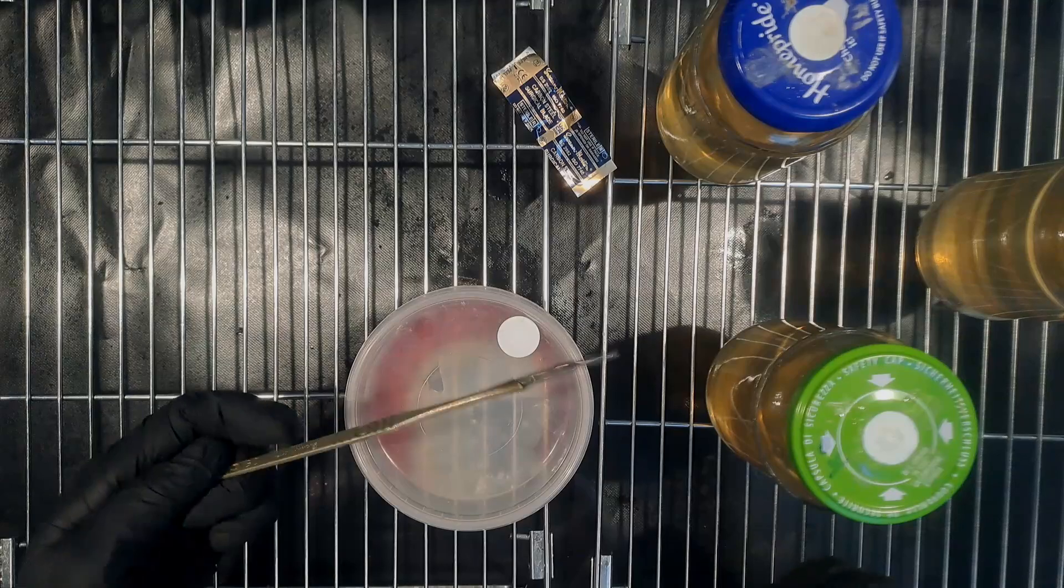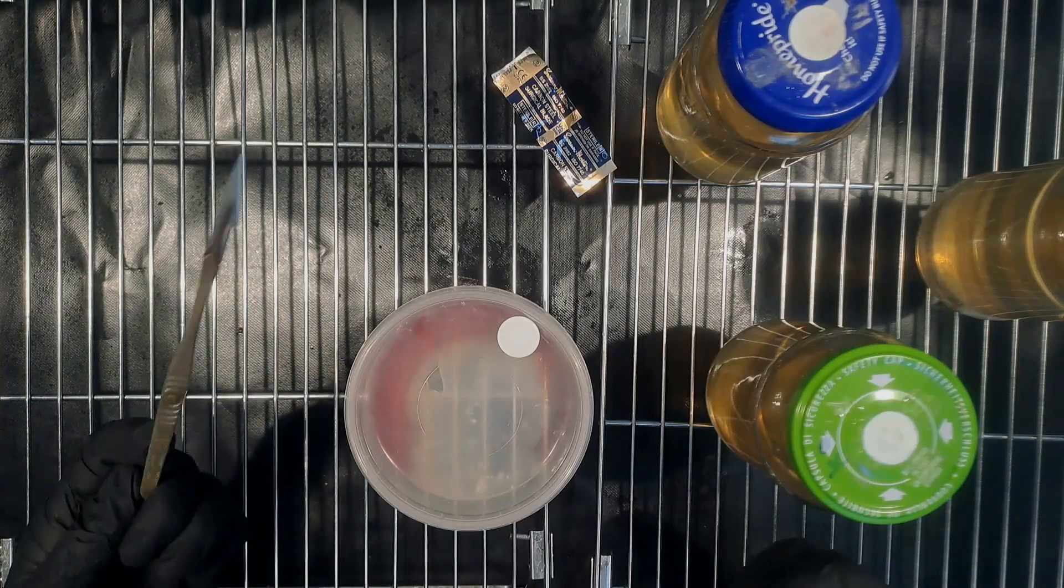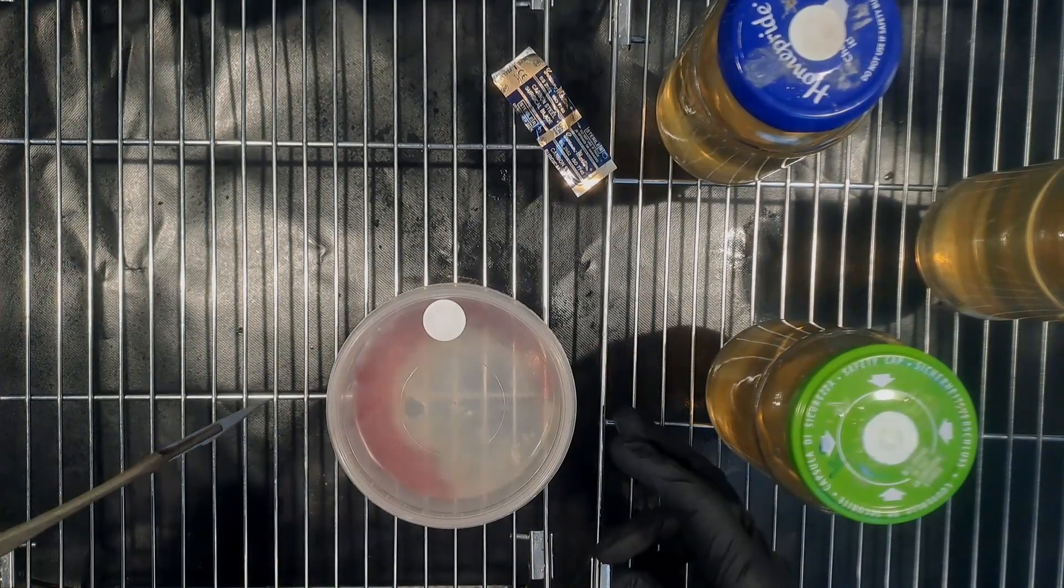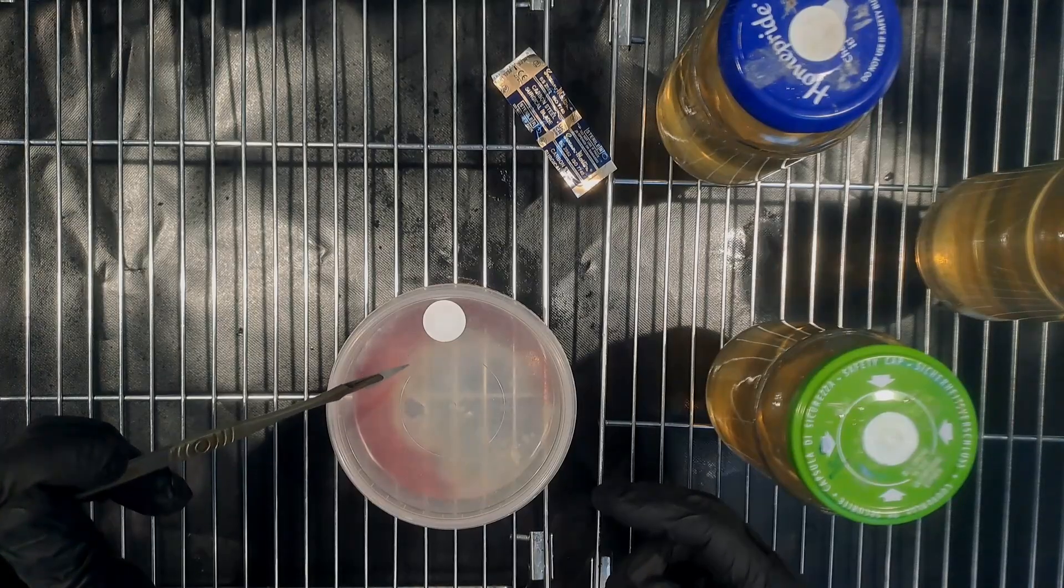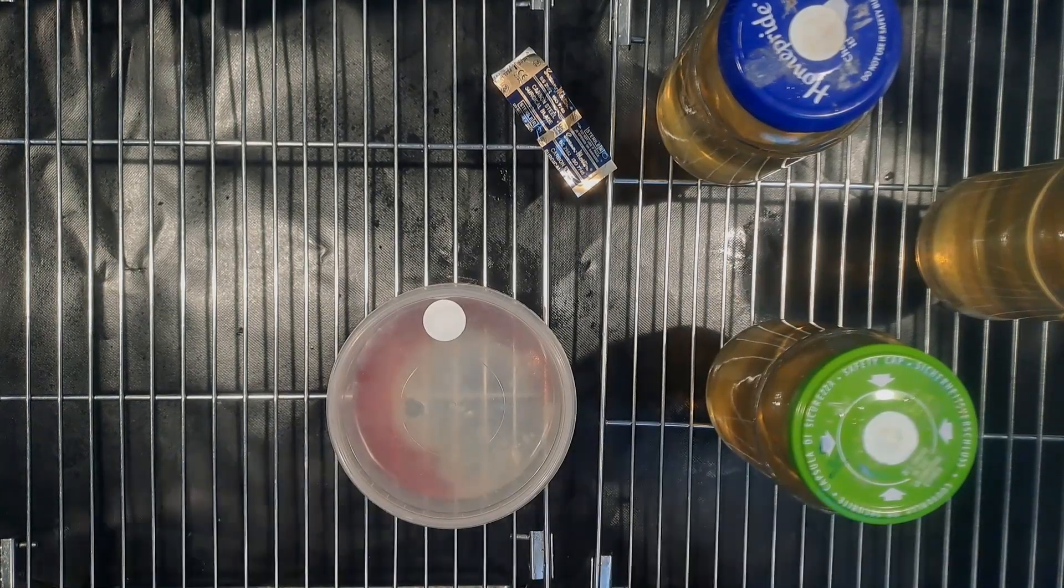Because I put the scalpel down and the actual tip of the scalpel was touching the top of that pot, I've took it out and flame sterilized it before I cut another wedge off the agar.